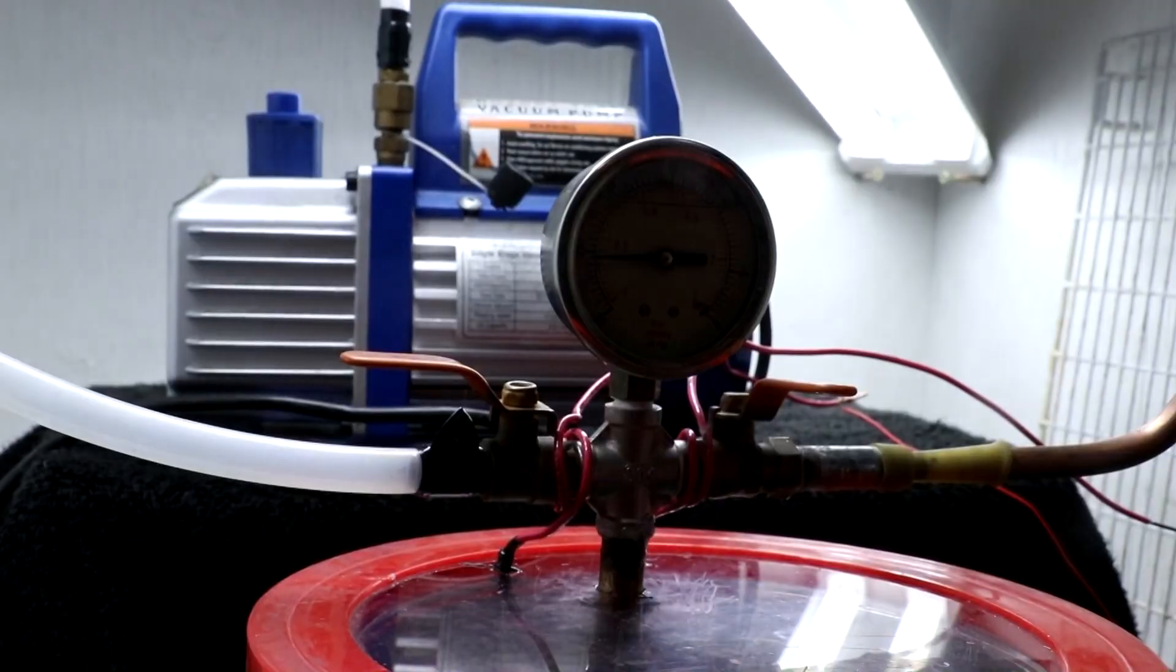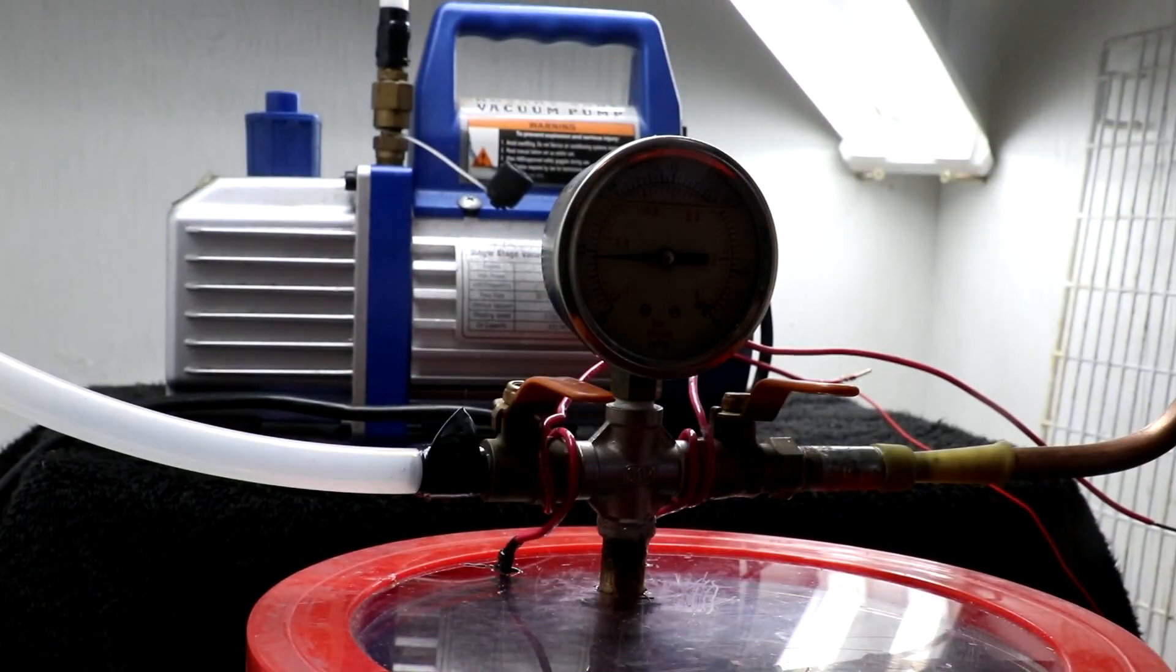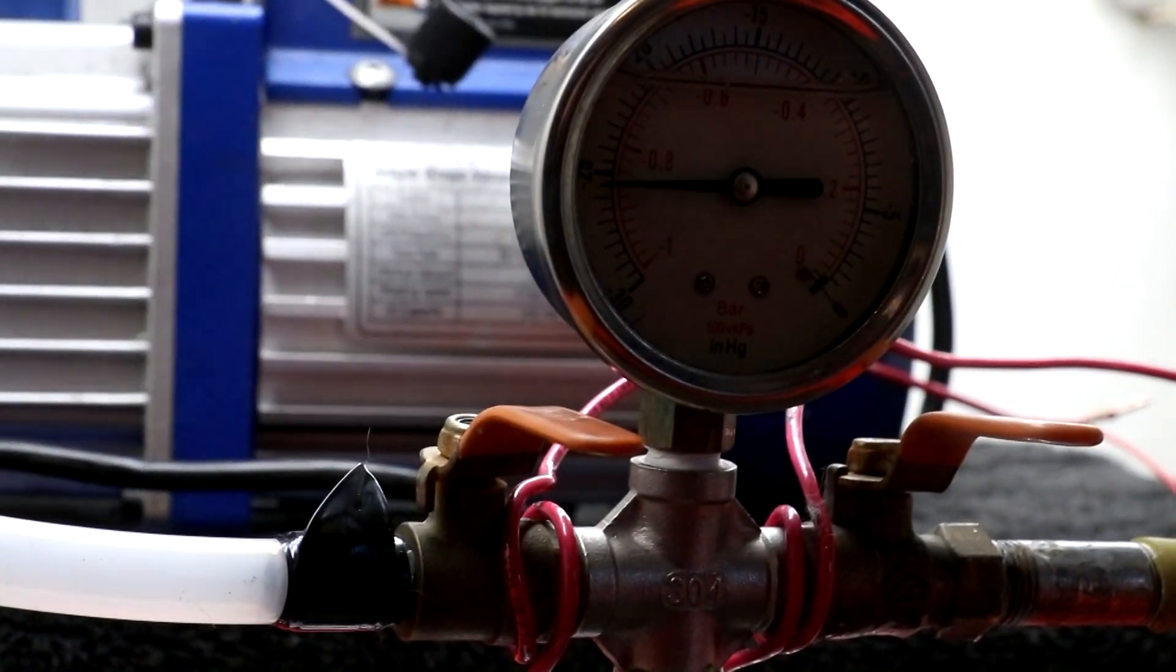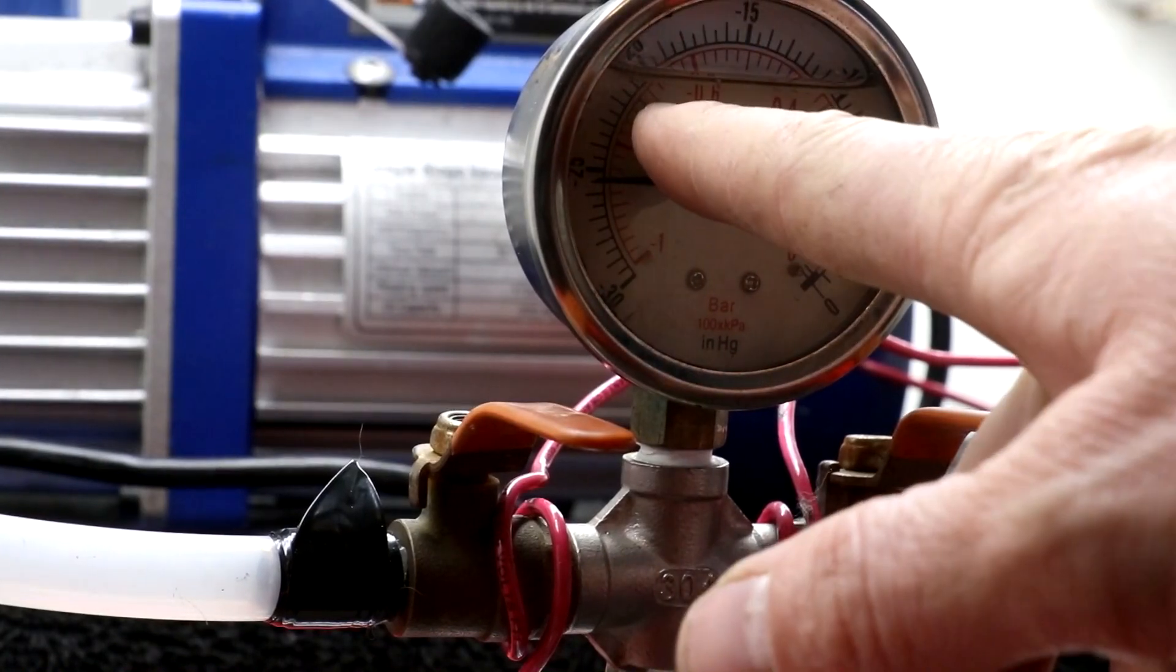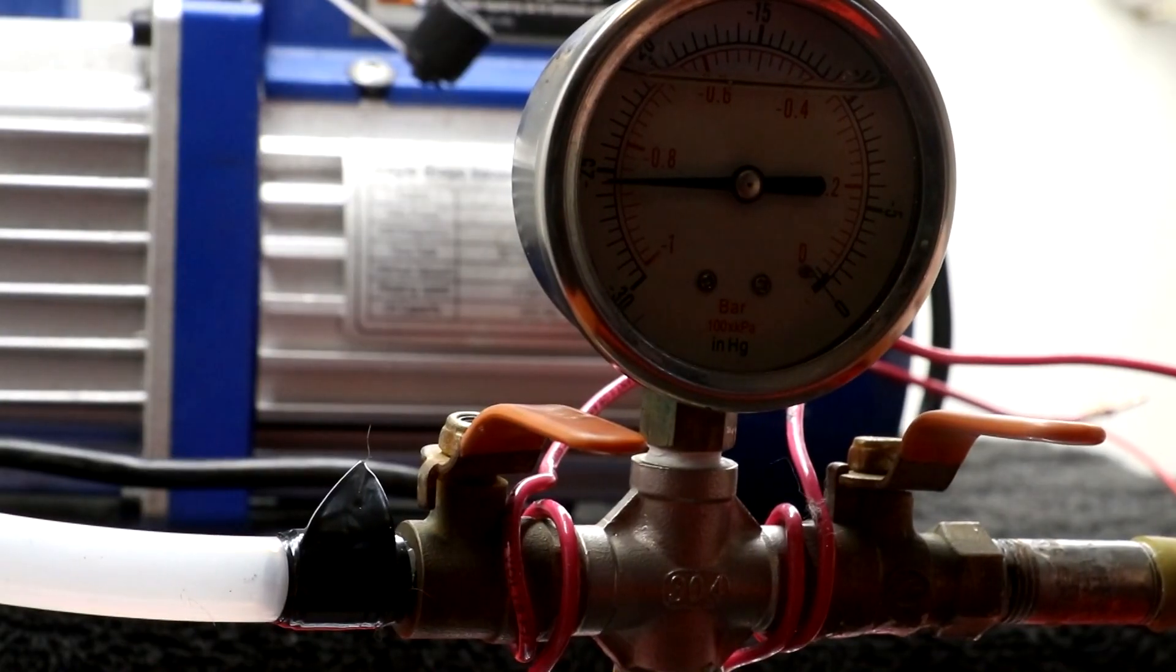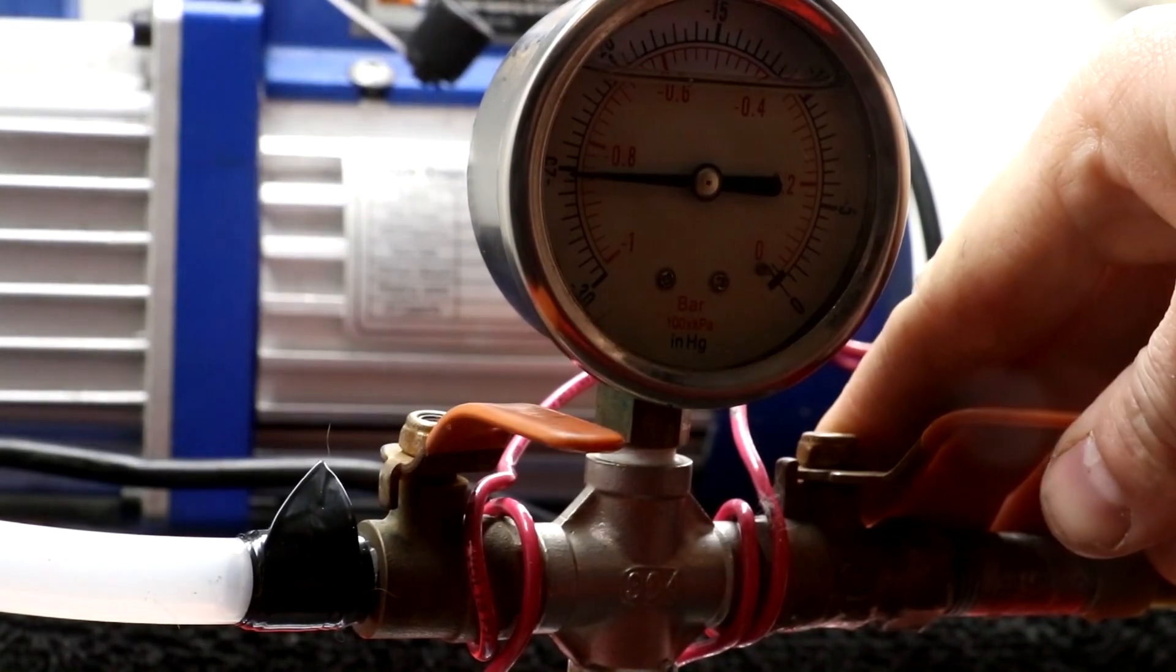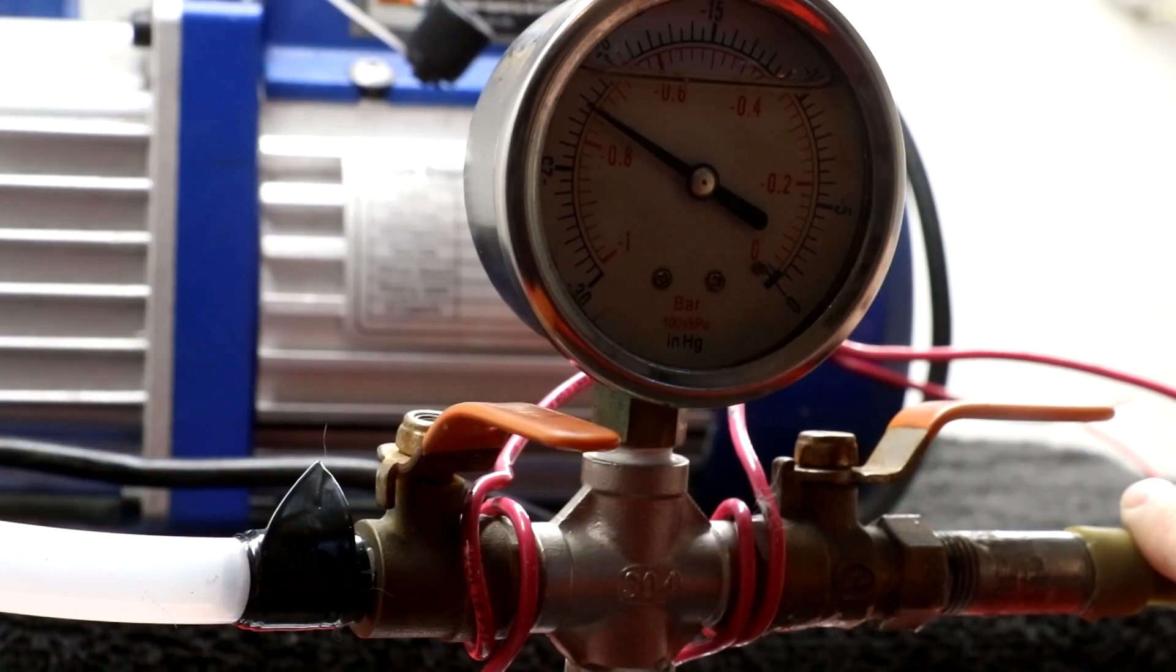Once again I have reset. Chamber is vacuumed out. Now we're going to take it from 25 and a half to 22 and a half worth of oxygen. Oh, guess it helps if I open the valve. Right about there.